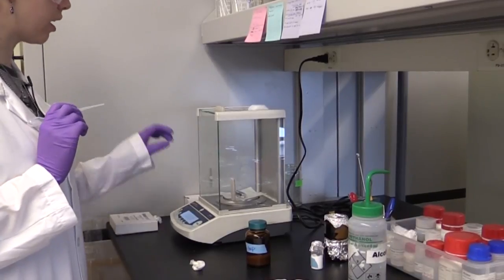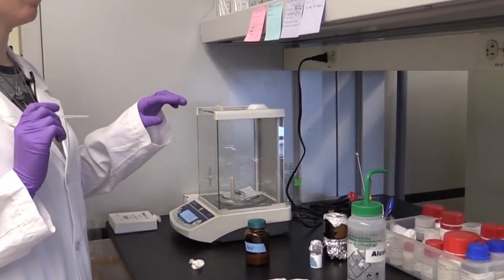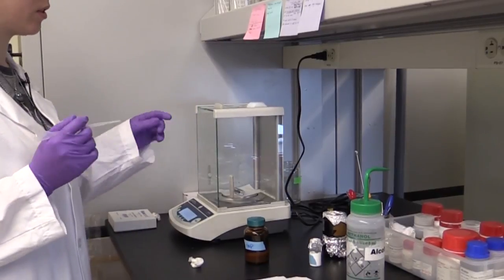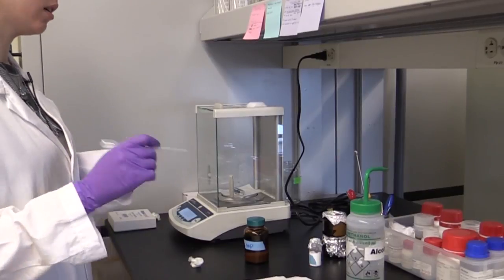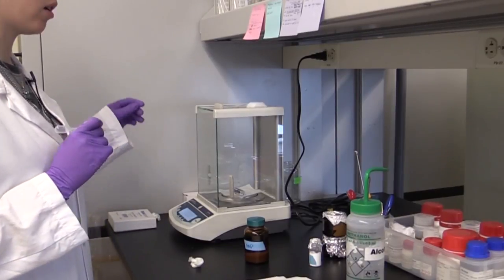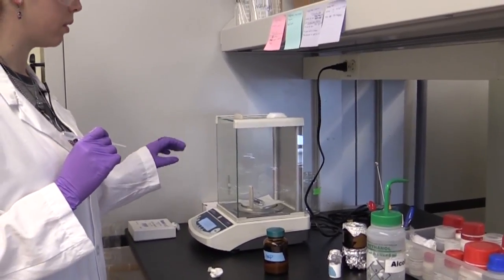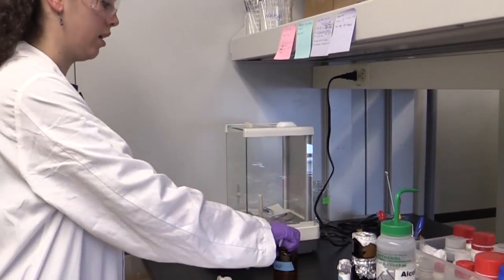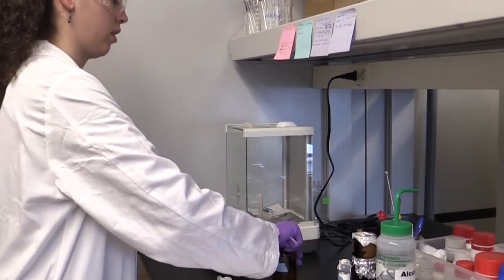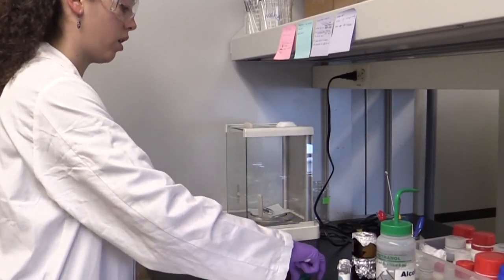For this mixture, 2 to 1% by weight of solvent to solid materials ratio will give you good viscosity. It depends mostly on the surface area of your materials, but for this one, 2 to 1% will give us good properties. So we just pipette the NMP into our flask.